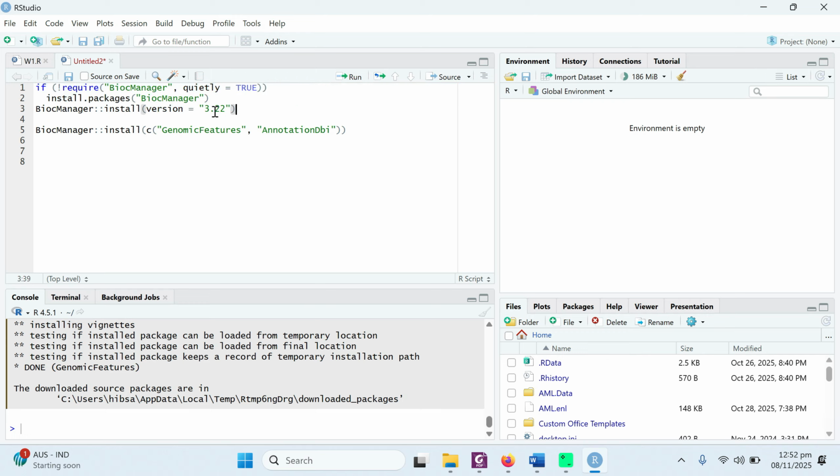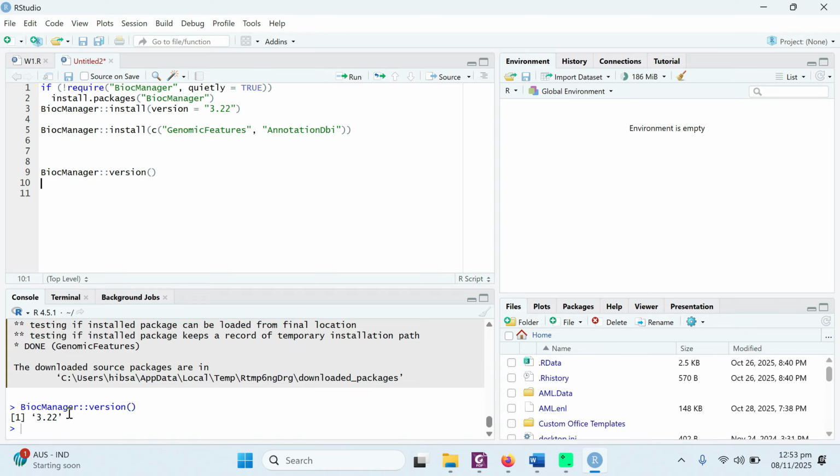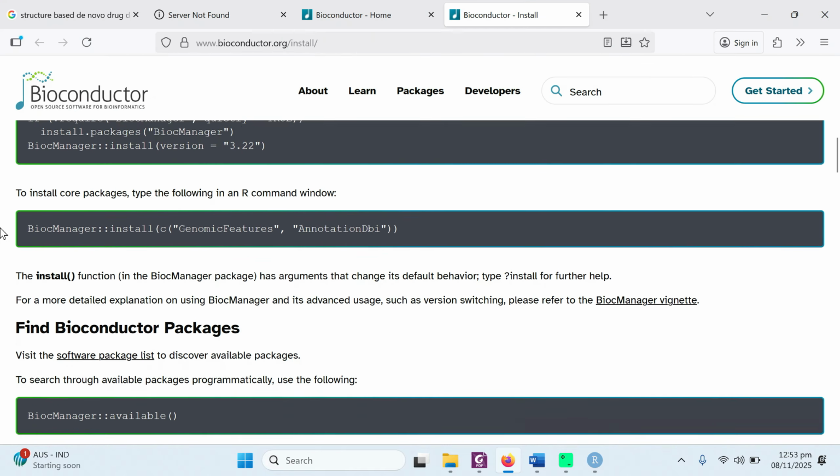This is the complete set of packages. It also contains GenomicFeatures and AnnotationDbi. But if you are specifically interested in GenomicFeatures and AnnotationDbi, then you can use this command. As we have completed the installation using this command, we don't need to run it again. If you want to see whether your Bioconductor manager has been installed or not, you can simply run this command, BiocManager double colon version, and press the run button. It will show that your current BiocManager is 3.22.